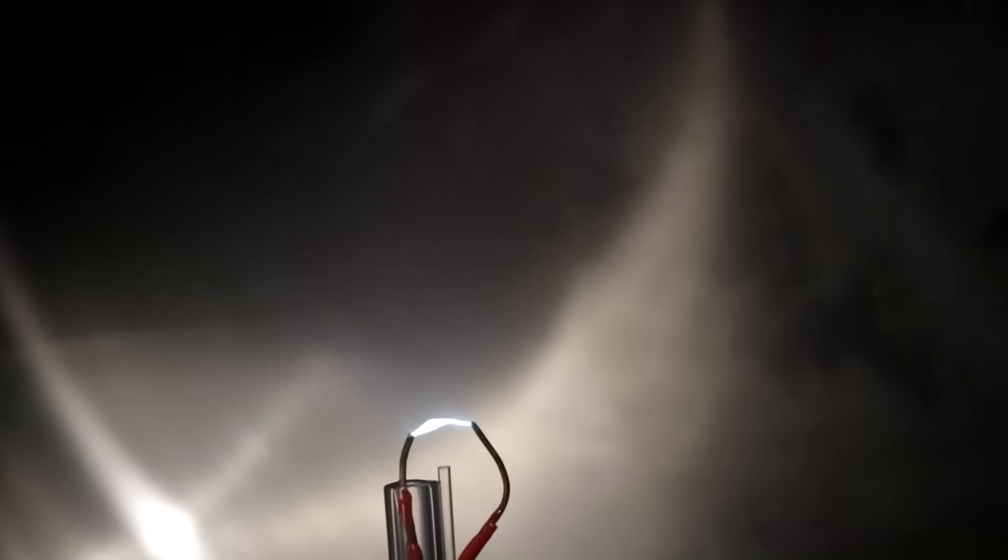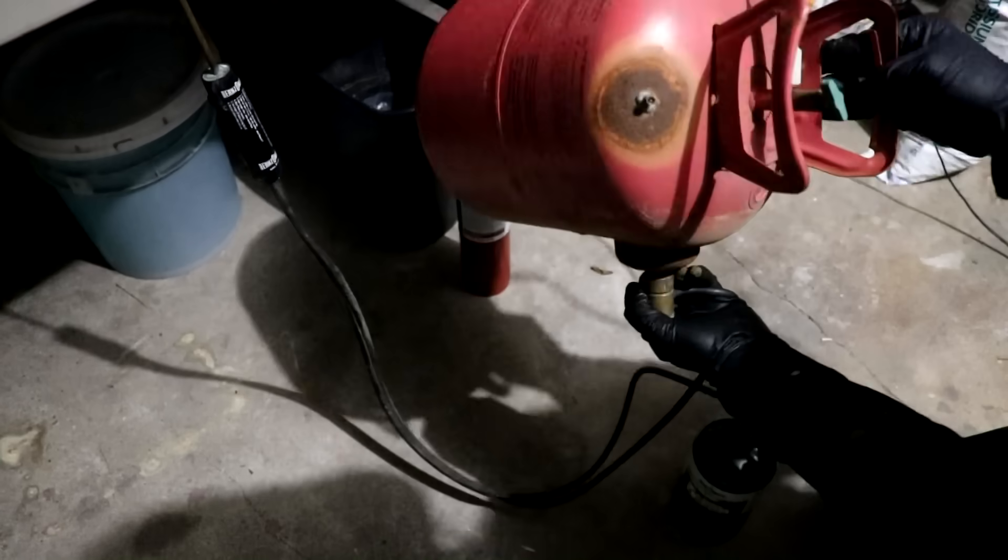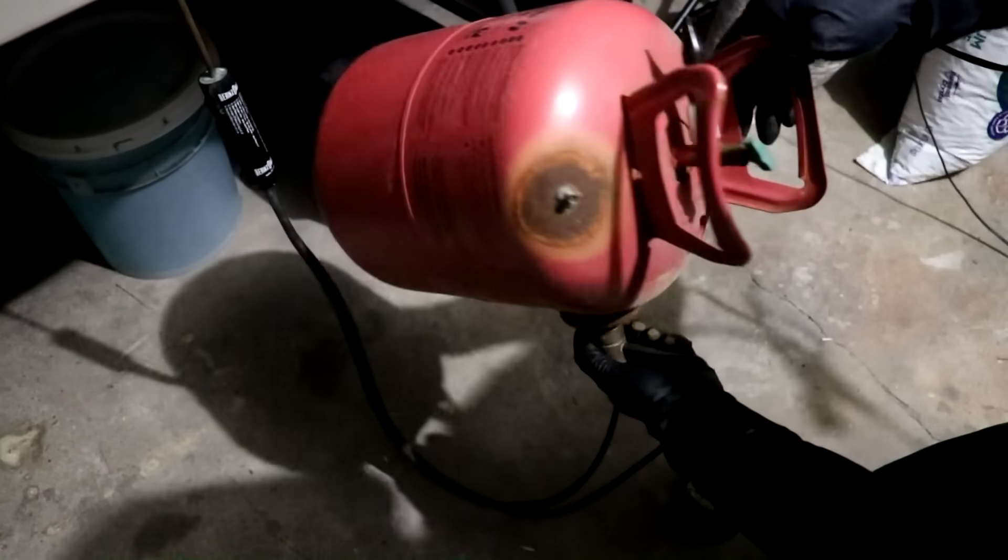Let's close the stop cock there. Let's kind of control the flow with my fingers here. Spark back on. Okay. Air does not seem to want to ignite. I guess that sort of makes sense. If you have a fuel that's got a lot of inert dilutant, then it has trouble burning.